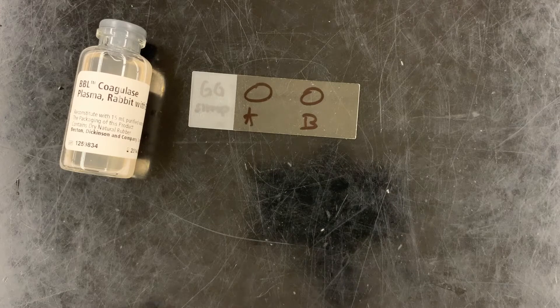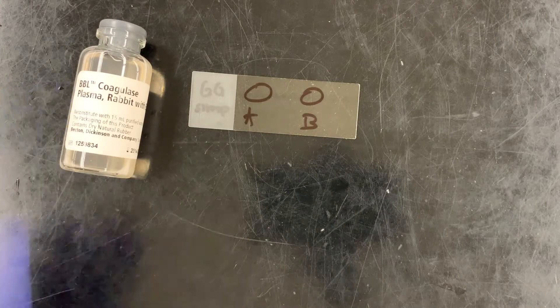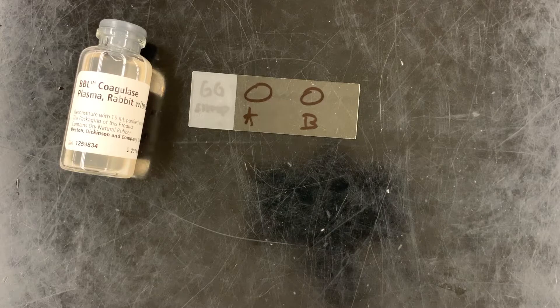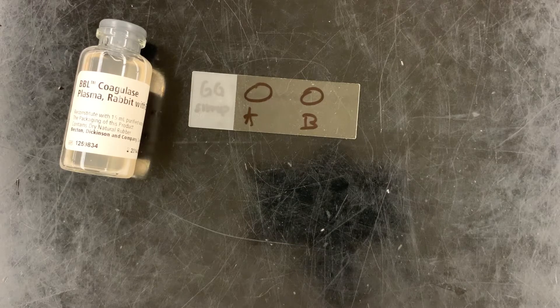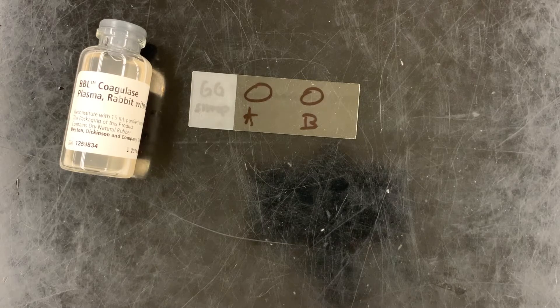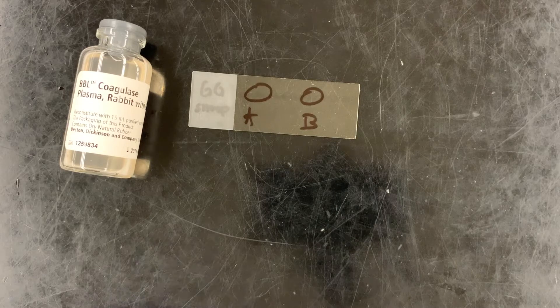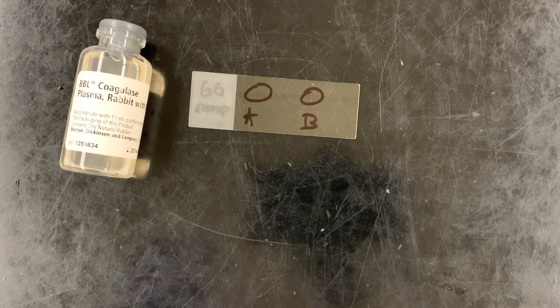Our reagent today is going to be rabbit plasma — just the plasma of rabbit blood — and then we're going to determine whether our test bacteria are going to cause coagulation, and we'll see this as clumping.